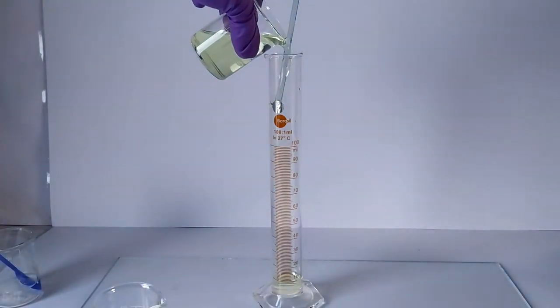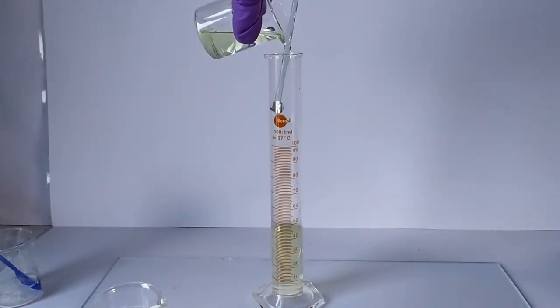Transfer this solution into a 100 ml graduated cylinder or volumetric flask.